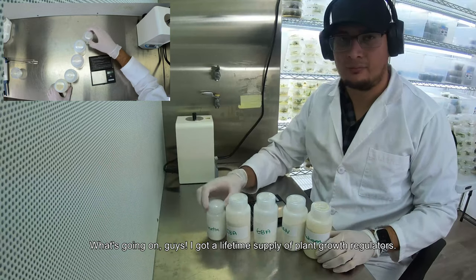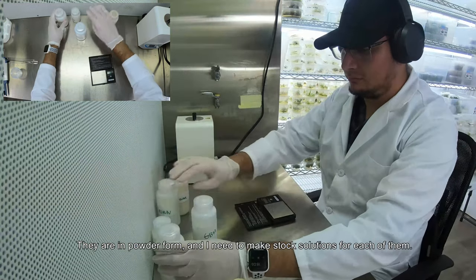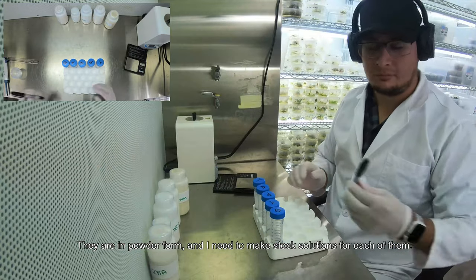What is going on guys? I got a lifetime supply of plant growth regulators. They are in powder form and I need to make a stock solution for each of them.